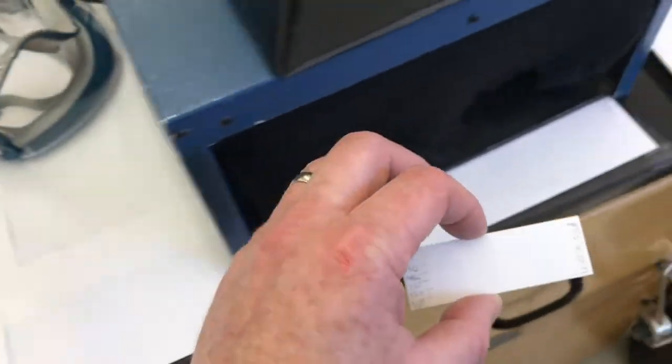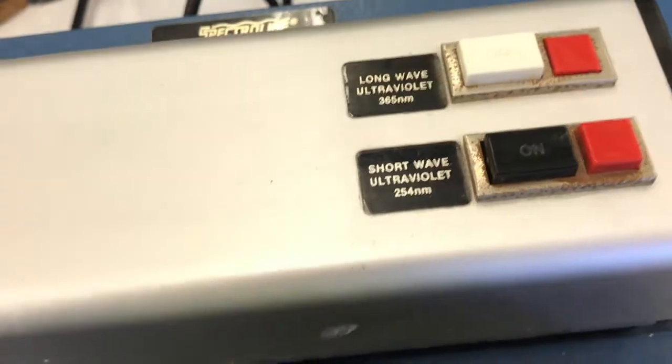Let's put this in the UV lamp box before we run it and see how it looks. Okay, here we are. I've got the 254 nanometers. There it is, it looks good. So we have the fluorenone spot, the one that was fluorenone dissolved in methylene chloride. 0 seconds is the fluorenone in methanol. And then the first time spot, was not at 10 seconds, but at 34 seconds. But they all look good. That's on the first TLC plate. Let's check the second one.